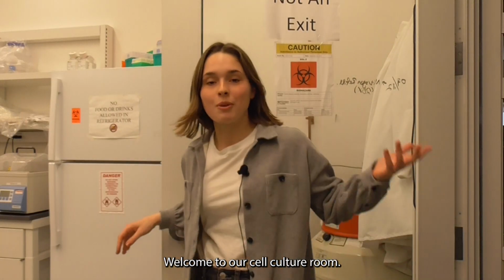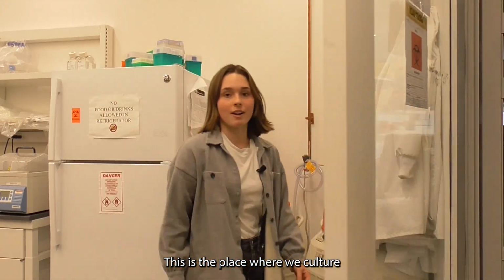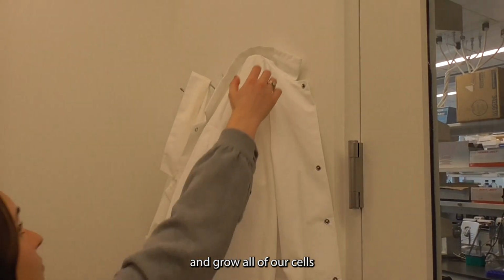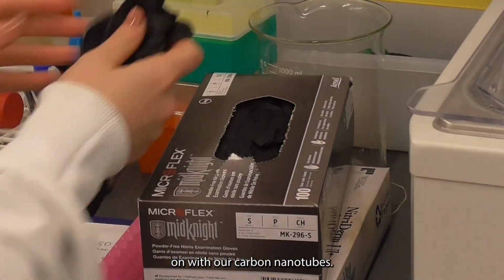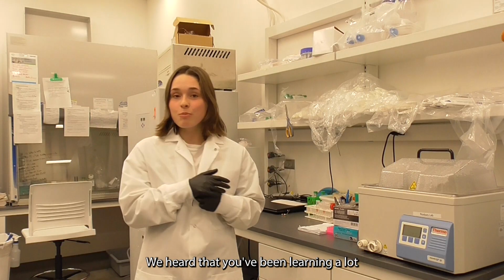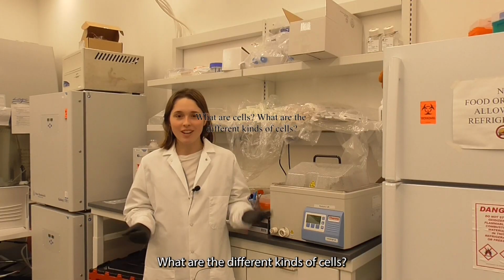All right, welcome to our cell culture room. This is the place where we culture and grow all of our cells that we perform experiments on with our carbon nanotubes. We heard that you've been learning a lot about cells in your science classes. What is a cell? What are the different kinds of cells?